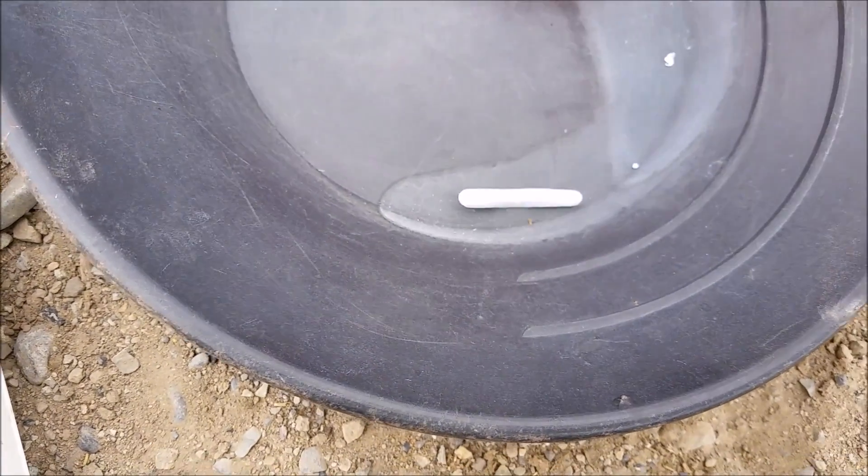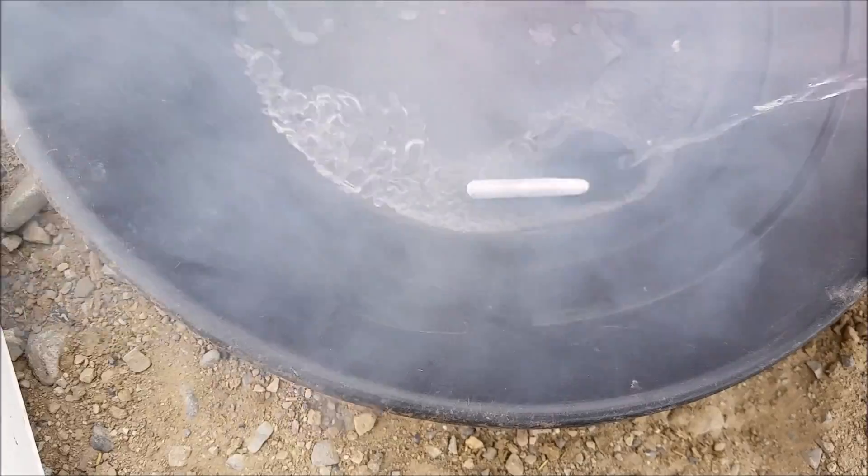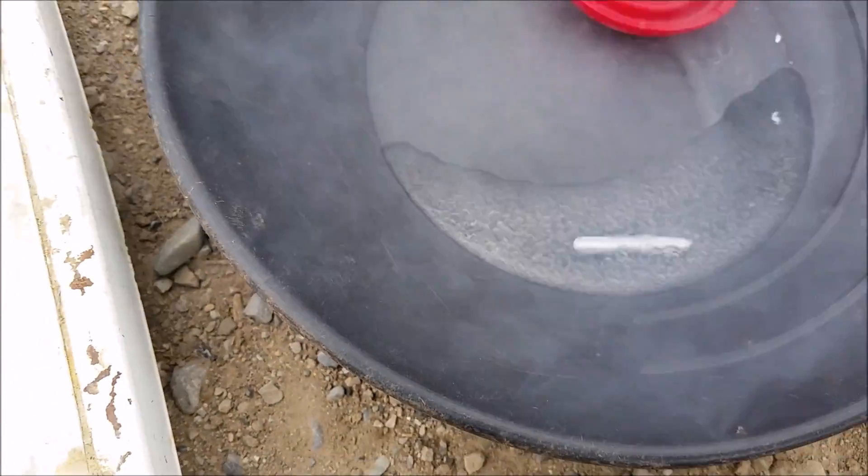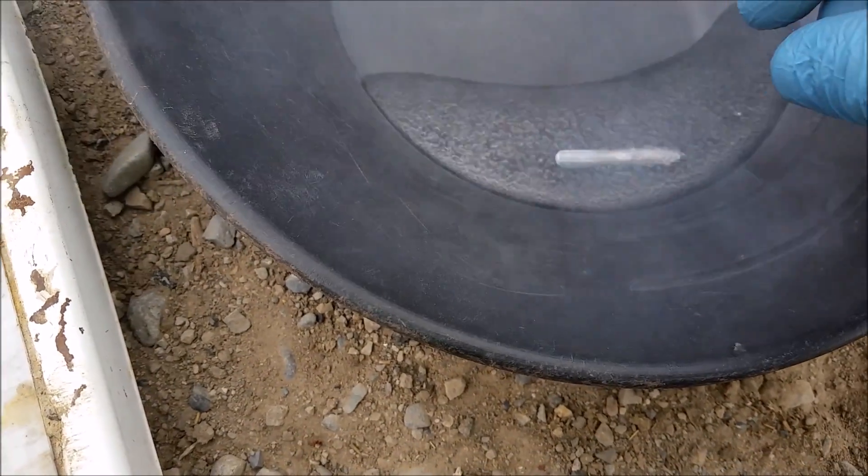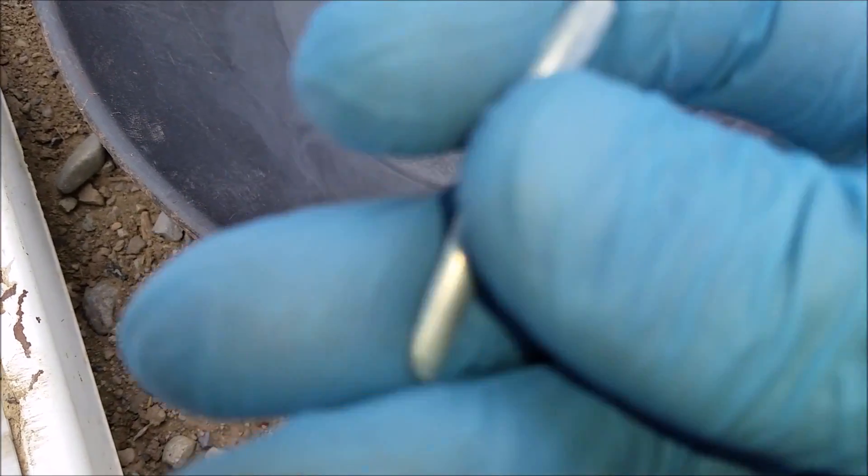Let's add some more nitrogen, it's warming up very quickly. Let's get that out of there. Alright, I don't know where the sound is on this camera, but listen to this.